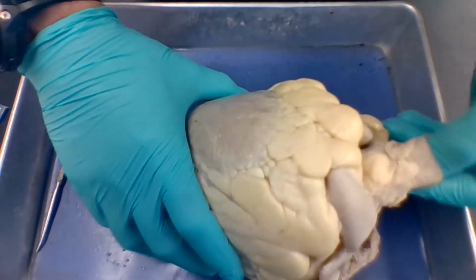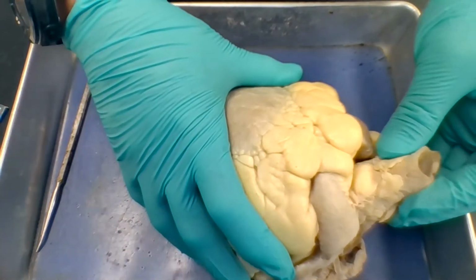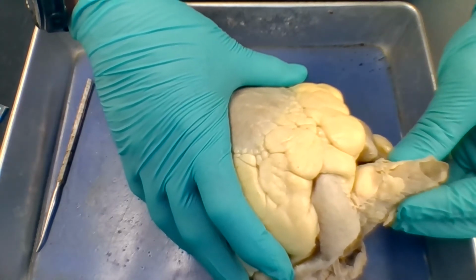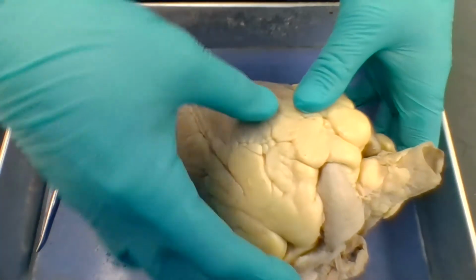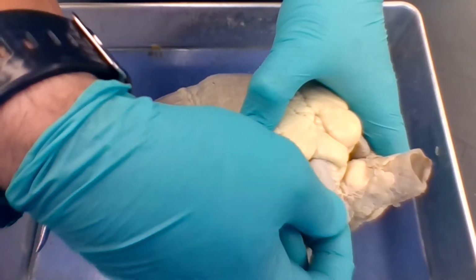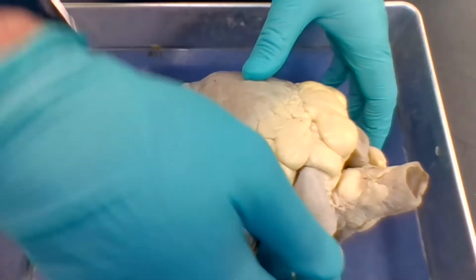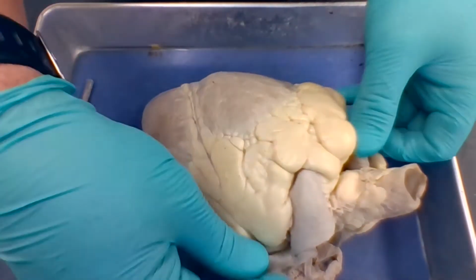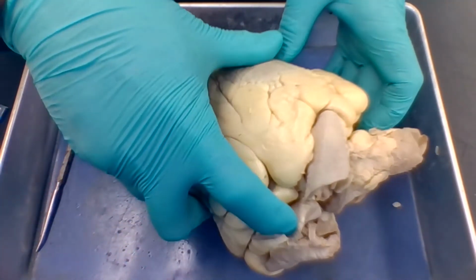Pericardial fat. Up here on top, you can see some structures here, some tubes, this right here. This is an artery. Know that because it's thick-walled, right? Arteries carry blood away from the heart. This is a thick-walled muscular tube. This is the aorta, okay? Over here, another thick-walled, so that's going to be taking blood away from the heart. That's artery. So that's the pulmonary trunk. The aorta is going to supply the body. The pulmonary trunk is going to take blood to the lungs. Okay, aorta, pulmonary trunk. These elephant ear looking things here and here, these are called the auricles.